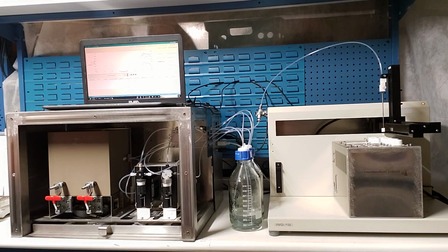Right now we're at baseline, waiting for 200 data points at 16 hertz. We have an injection. Sample goes up towards plateau. Within 1 minute, we get the data for one injection. Then we have loading, and then again a subsequent injection. This is what we call classic mode.